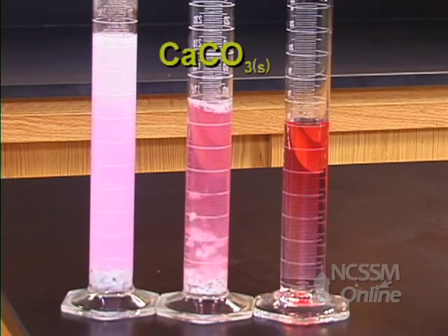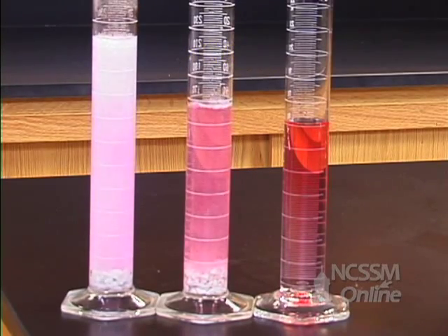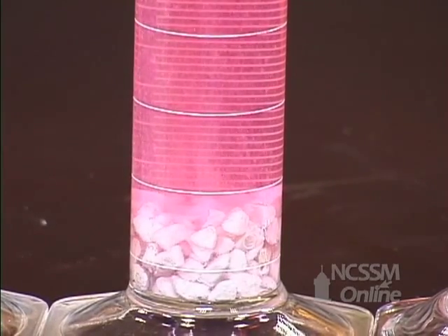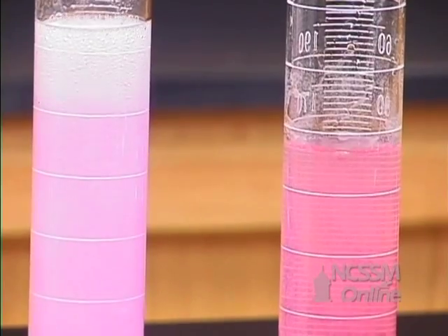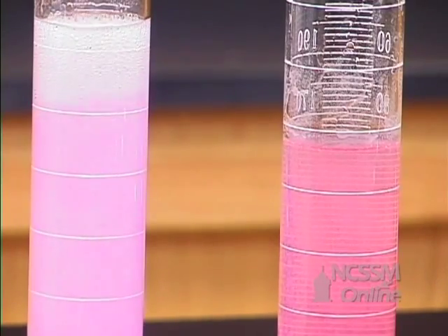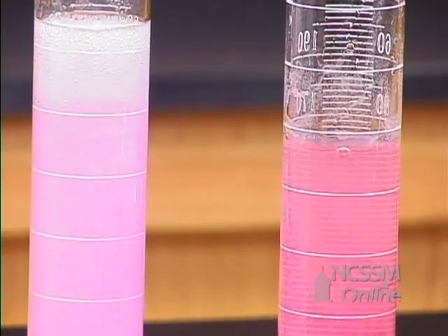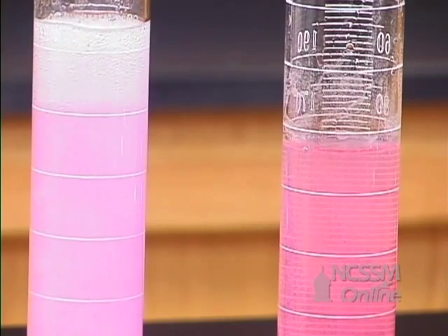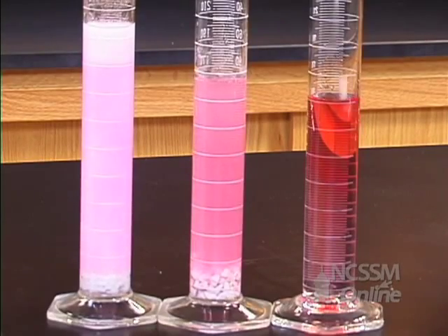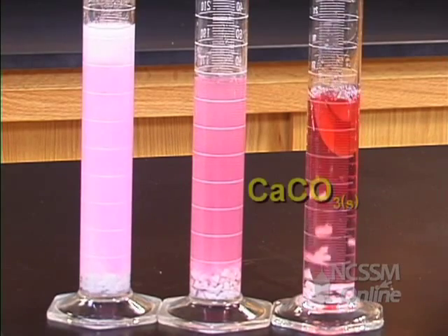We'll add the same amount of calcium carbonate to the acetic acid. We can see that we're getting carbon dioxide produced, but at a much slower rate than the solution of hydrochloric acid. The two molar acetic acid has a much lower hydrogen ion concentration than the two molar hydrochloric acid.